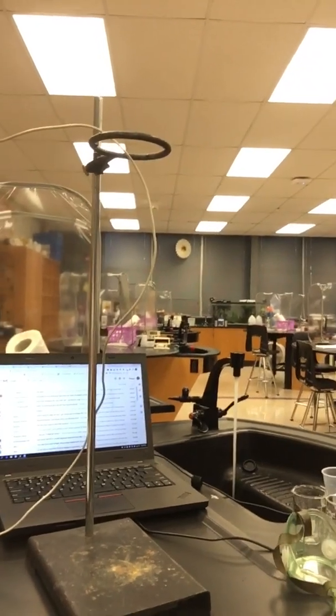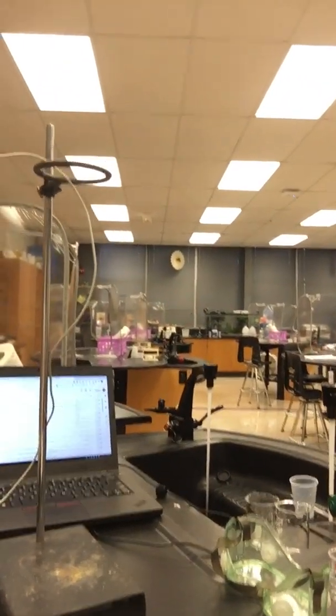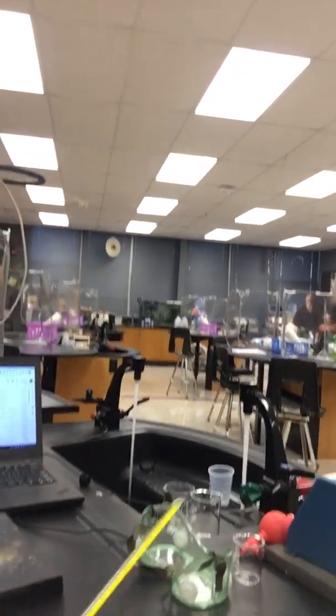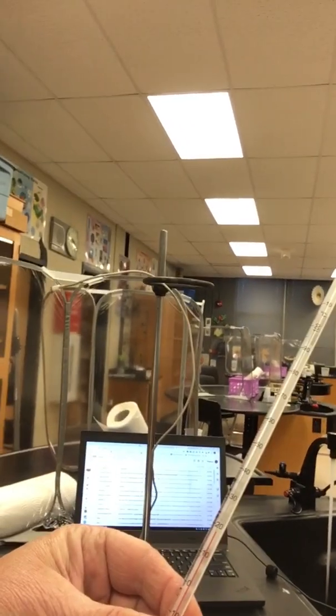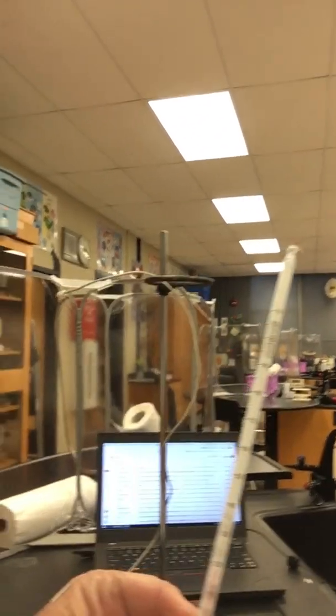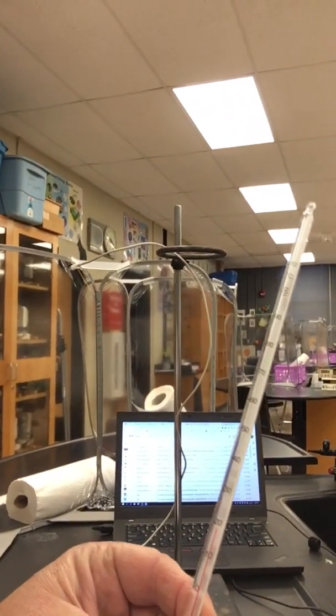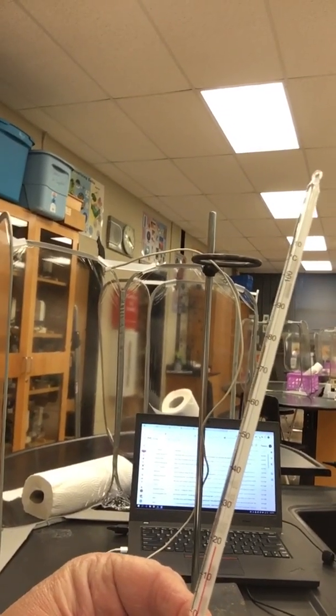And I'm going to get a thermometer. My thermometers are mostly Celsius ones, but I also have one that has Fahrenheit. And so just to pick it up to start with, it looks like the temperature in my room has warmed up just a bit, a degree or so, and right now it is 18 degrees Celsius in my room. 18. Normally room temperature is around 22 degrees Celsius.